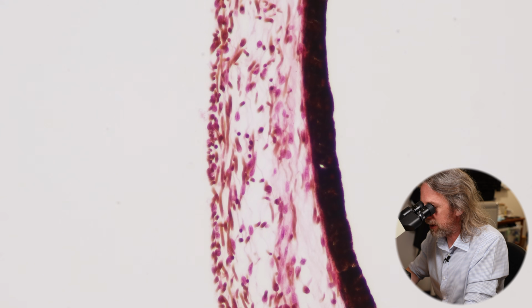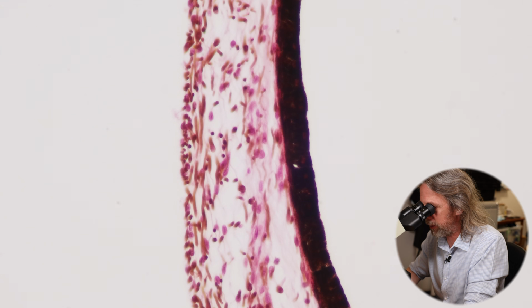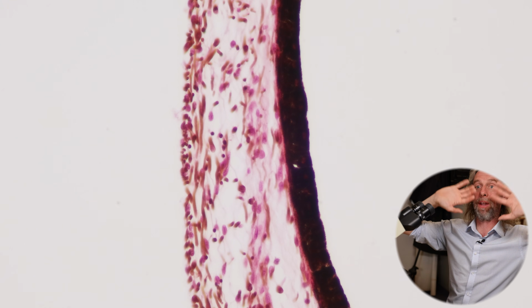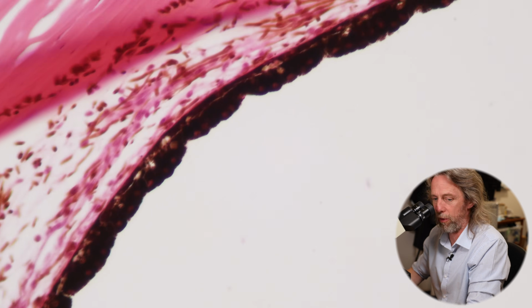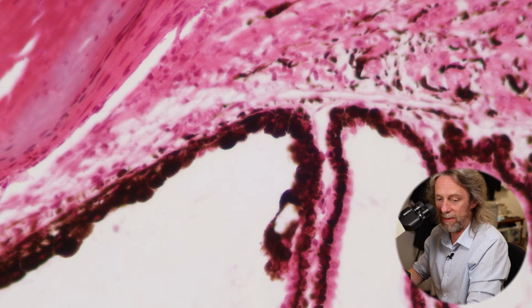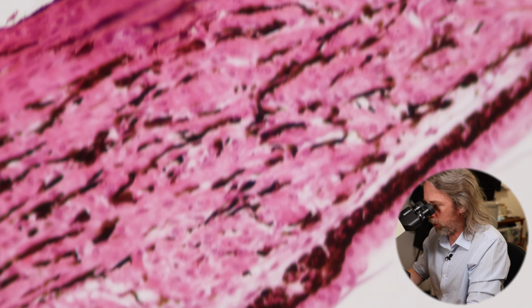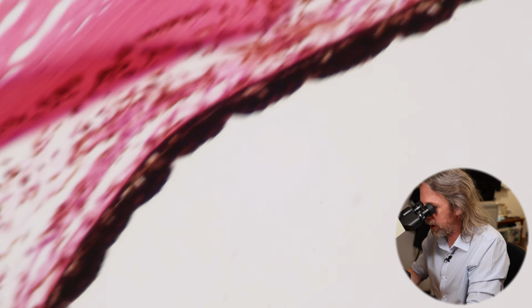We have got 2 layers on that side. There is a smooth muscle layer, which is a little bit reddy pinky, and then there is a heavily pigmented layer. Now that heavily pigmented layer, so again lots of melanin being made by melanocytes, that's what we find throughout the inside of the eyeball. So this is a continuation of that. If I slide up, is this going to be off-putting? There we go. We follow the iris around, we can see how it meets the inside of the eyeball, and you can see how the inside of the eyeball is similarly pigmented as we follow it around. Let me go back to that, the iris there.